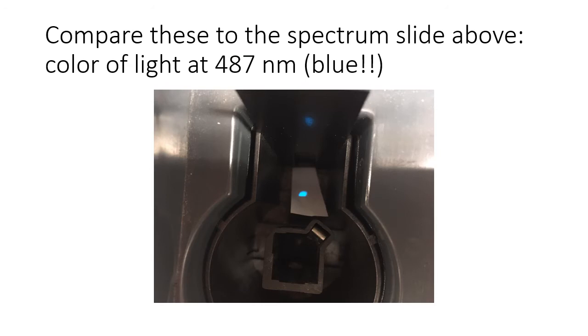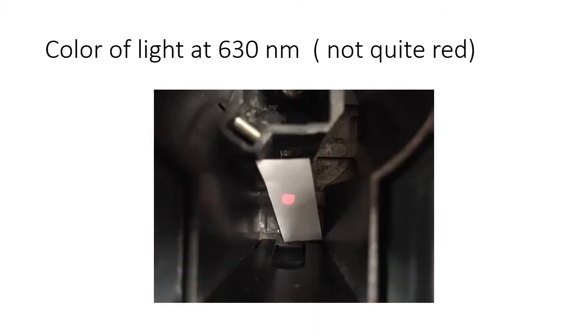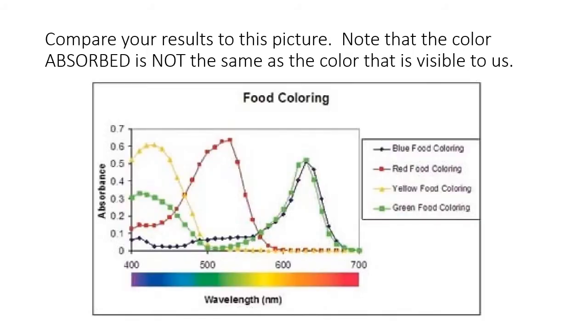Okay, so we have set this wavelength to 487 nanometers, and we can see a nice bright spot of blue light that's coming through the machine. So the 487 nanometer light is blue. Similarly, the 546 nanometer is a nice bright green color. And you will record these colors on your worksheet as you change the wavelength in 20 nanometer increments. Okay, here's 630. It's not quite red, but you're getting off to the other end of the spectrum. Okay, so compare your results to the picture. Notice that the color absorbed is not the same as the color that's visible to us.